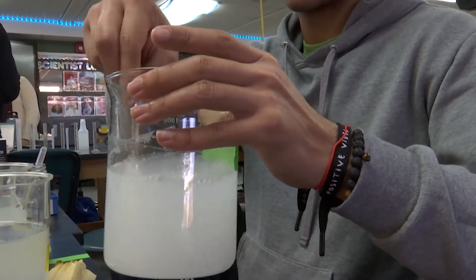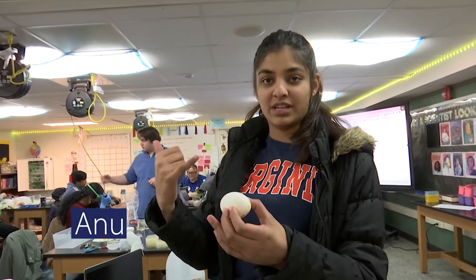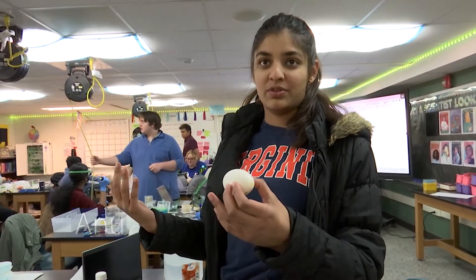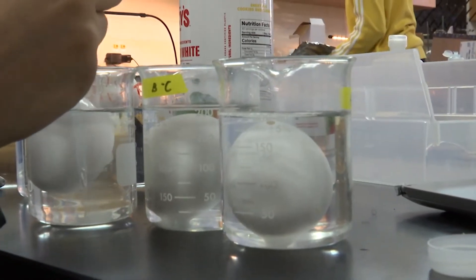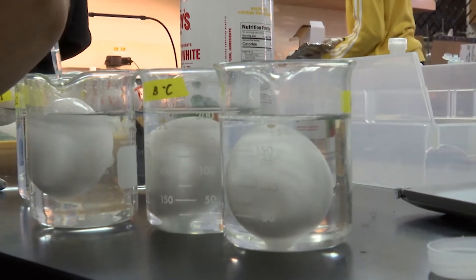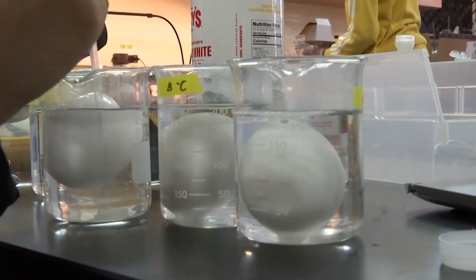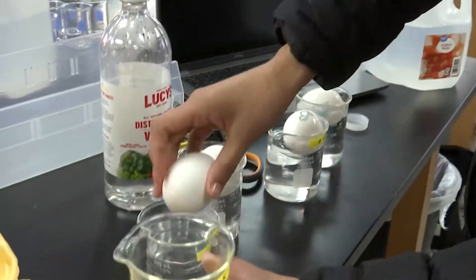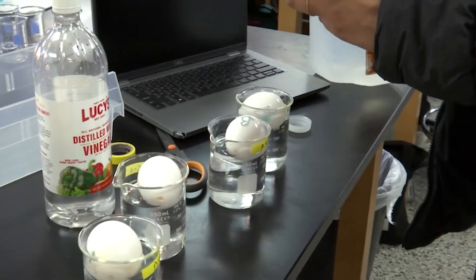It's about 500 milliliters of water, so it's about half. These are eggs — they're all emptied out. I put a hole in both sides and emptied them out. It's supposed to represent tooth enamel, so in my experiment I'm basically testing levels of vinegar on tooth enamel and how acidity will erode the teeth or if it will help it.